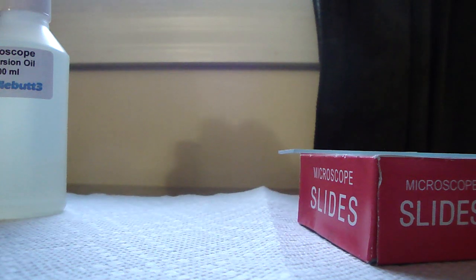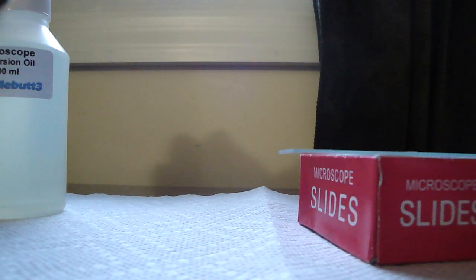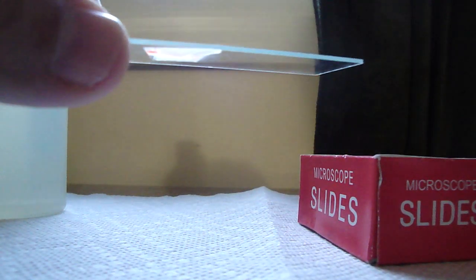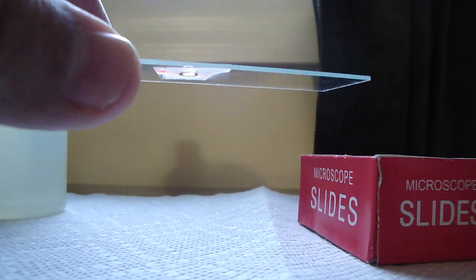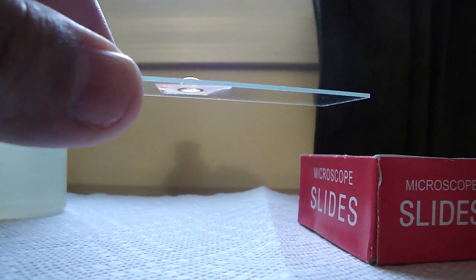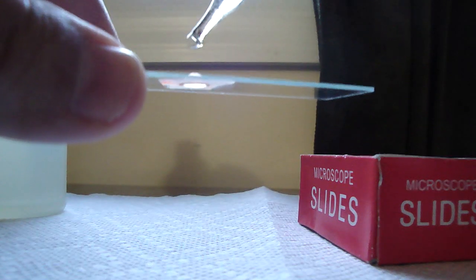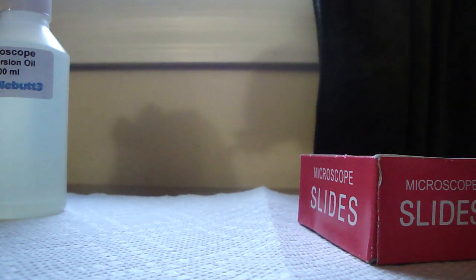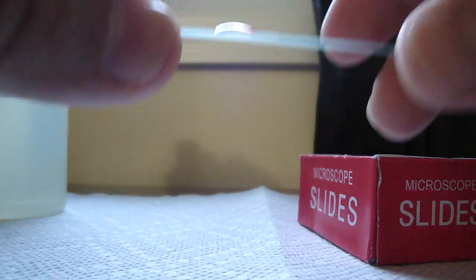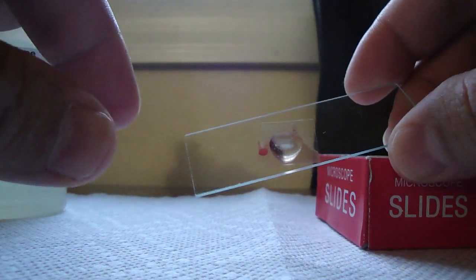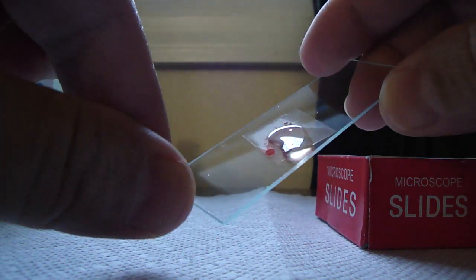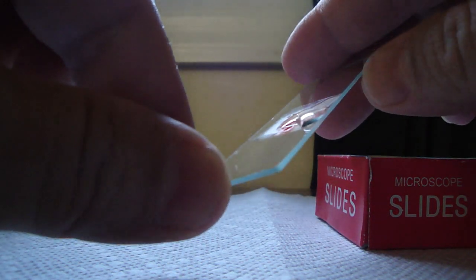And what I did through time, looking through various blood smears, one day I accidentally discovered that I was able to see my blood cells sometimes seven days after the initial smear, and they were still preserved rather well. And the reason that happened was I put a little too much oil on the slide. I put two drops right now. A little too much oil on the slide, and what it did is it went along the peripheral of the slip cover. It created a vacuum seal.